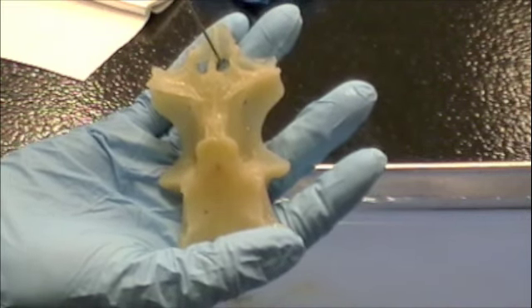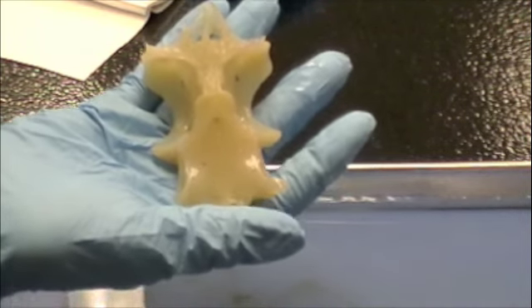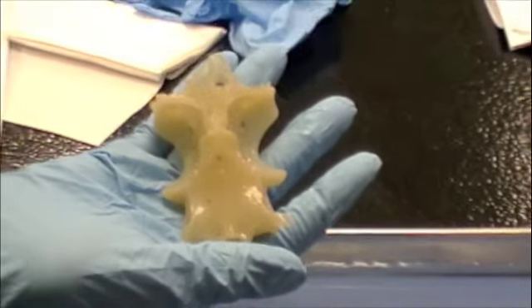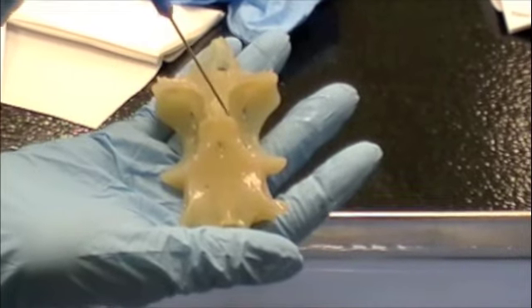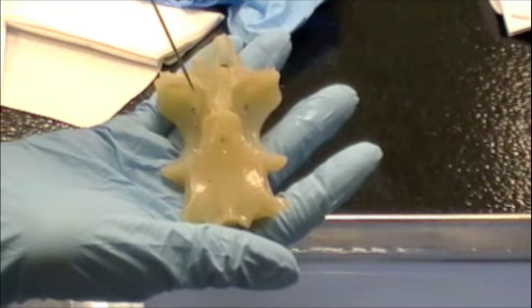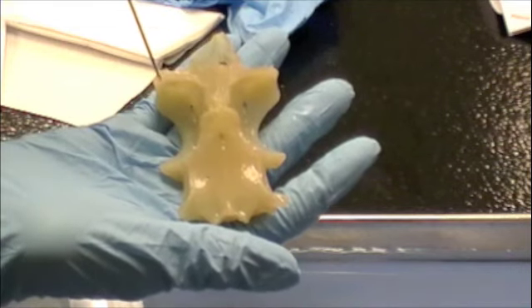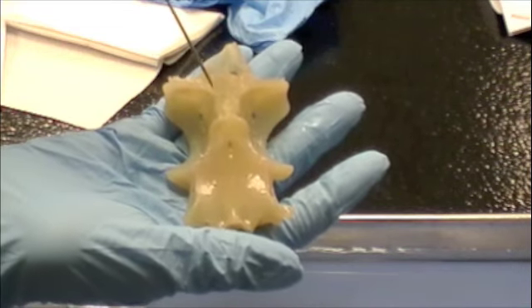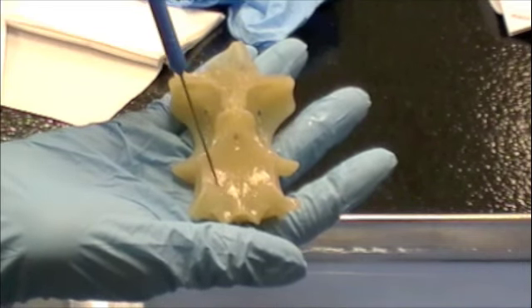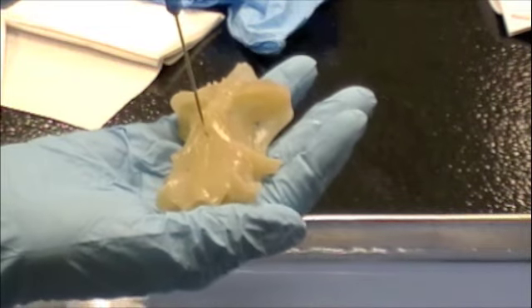Are these other holes more medial to the midline? We're going to be using science words. The basitrabecular process would be this thing right here sticking out — that would be the basitrabecular process. Carotid foramen. This little hole right here? Yeah, I think so.